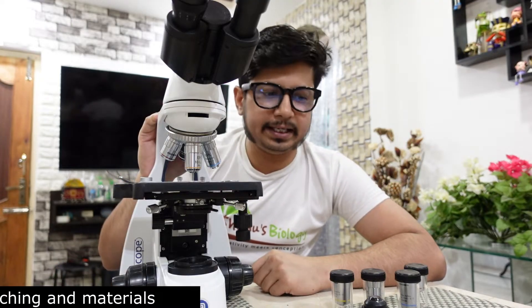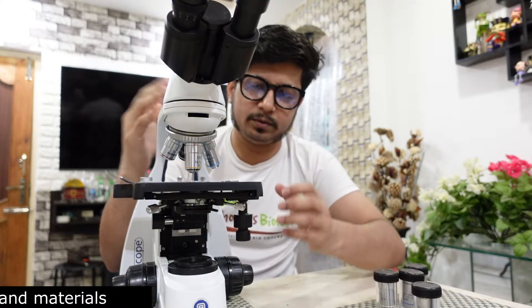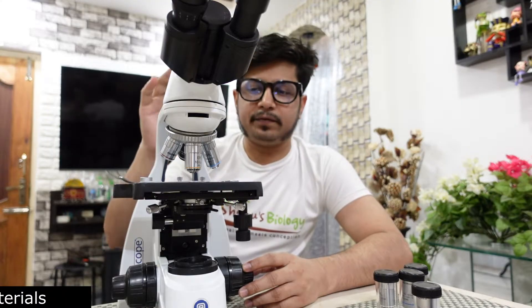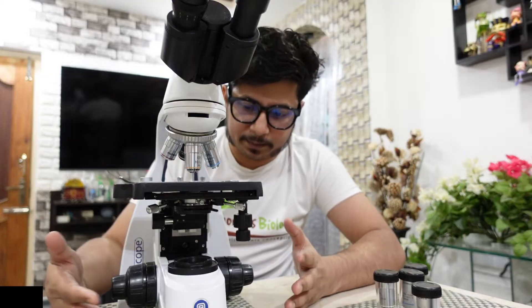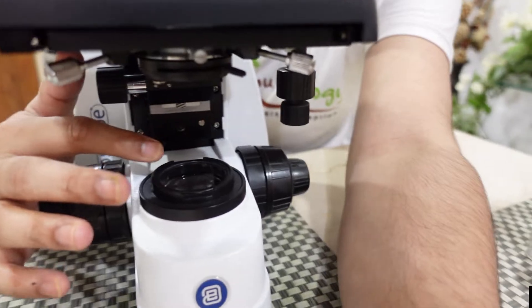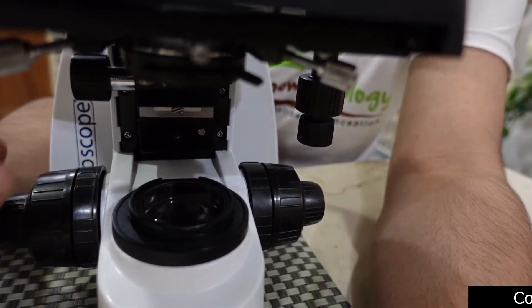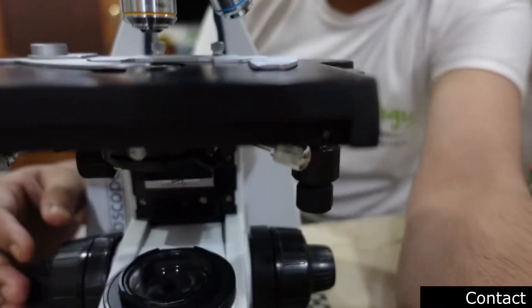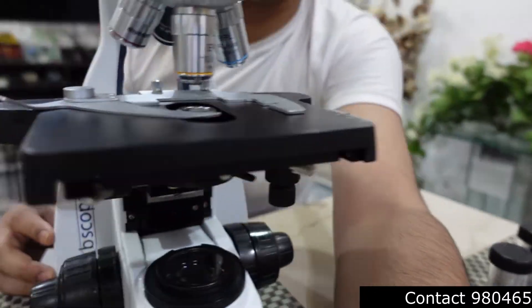I'll be stating you one thing at a time, all the important parameters. As this is a light microscope, the most important part is the light source. There is also a switch at the back to turn it on and off.